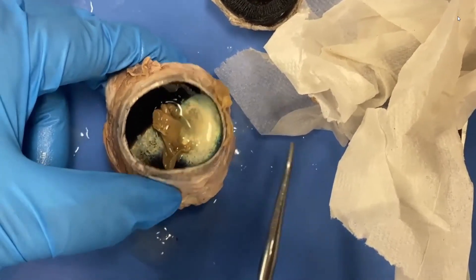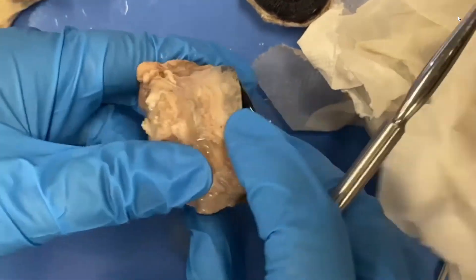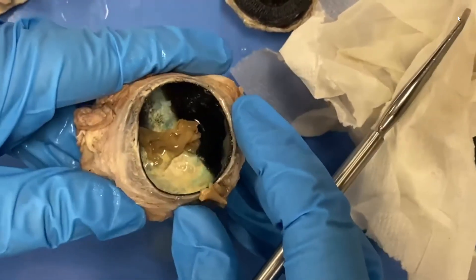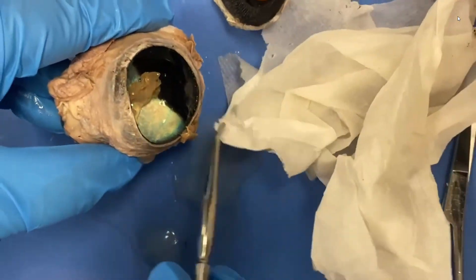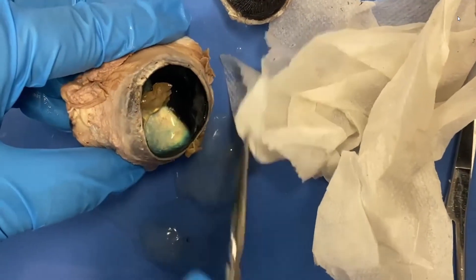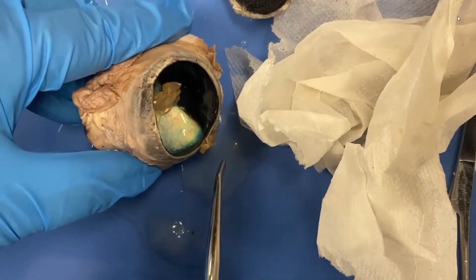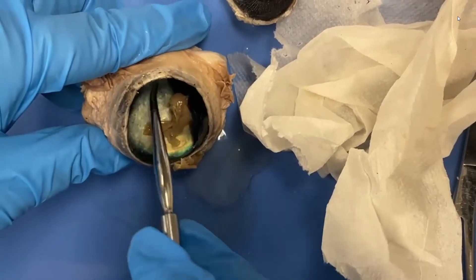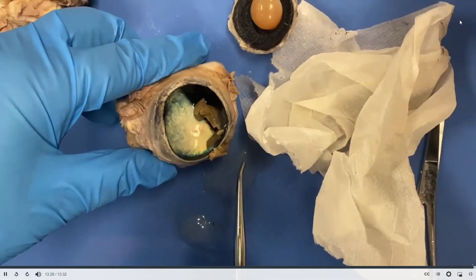Once you've done all that, you have done a great job dissecting the eye. Make sure to dispose of all your materials properly into the correct bag, and then they can go in the trash in an opaque bag.